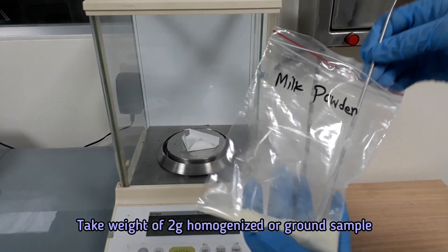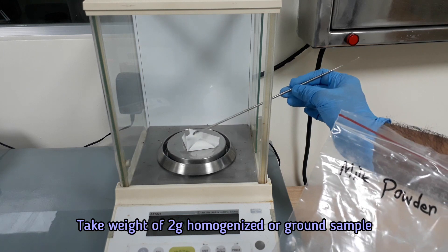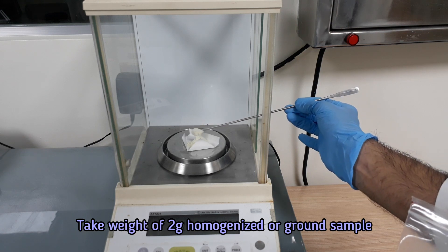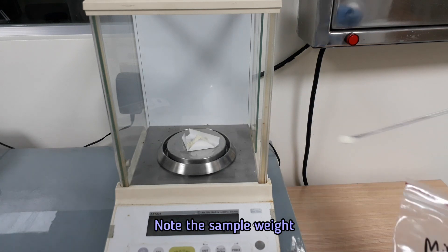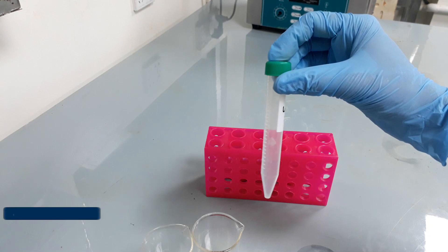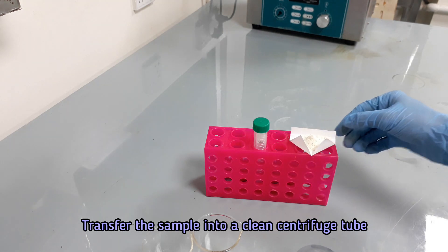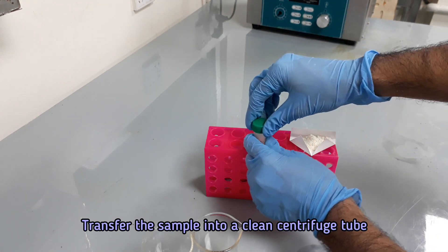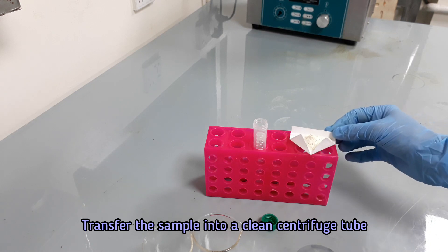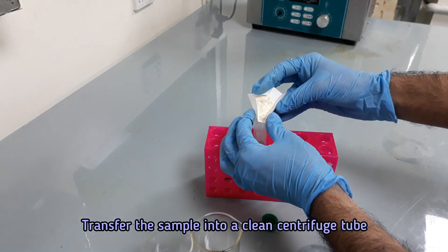Take a weight of 2 grams of ground or powdered sample. Note the sample weight. Transfer the sample into a 15 ml centrifuge tube.